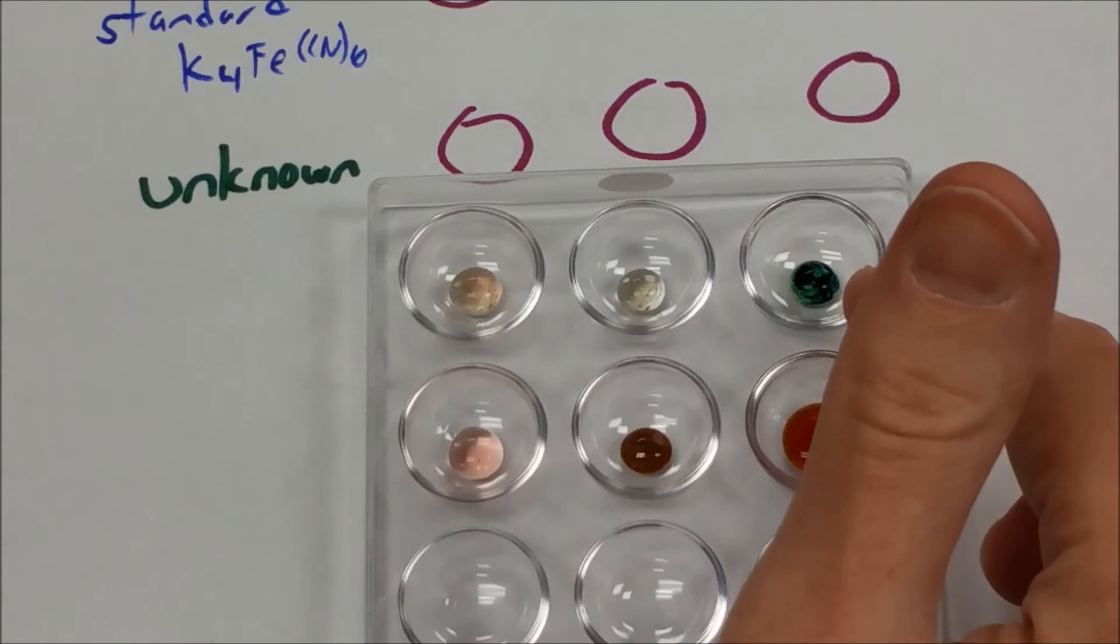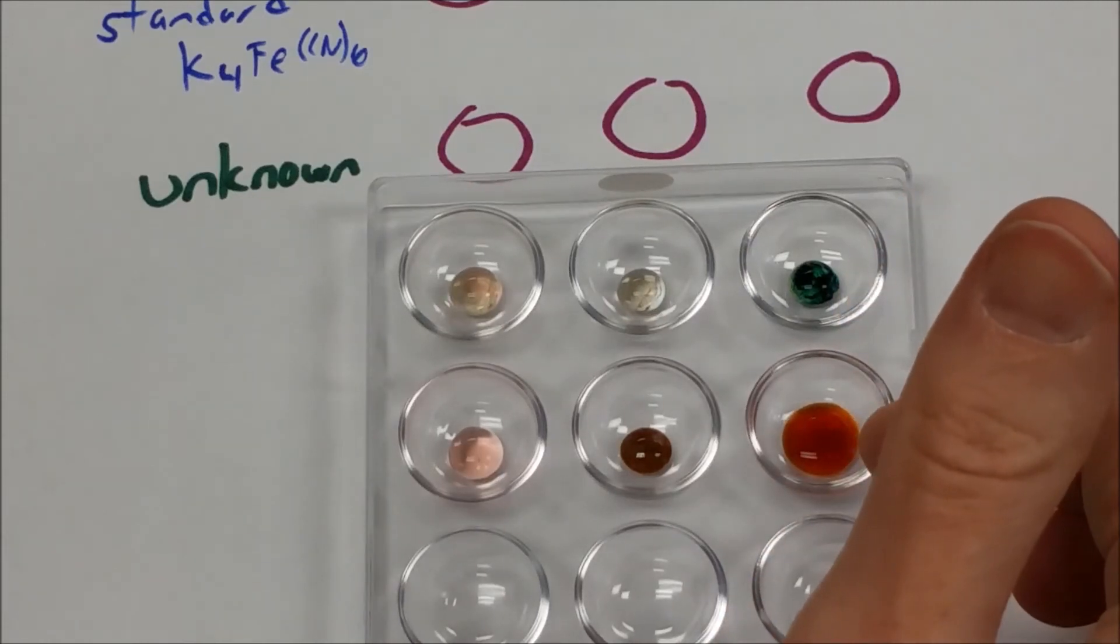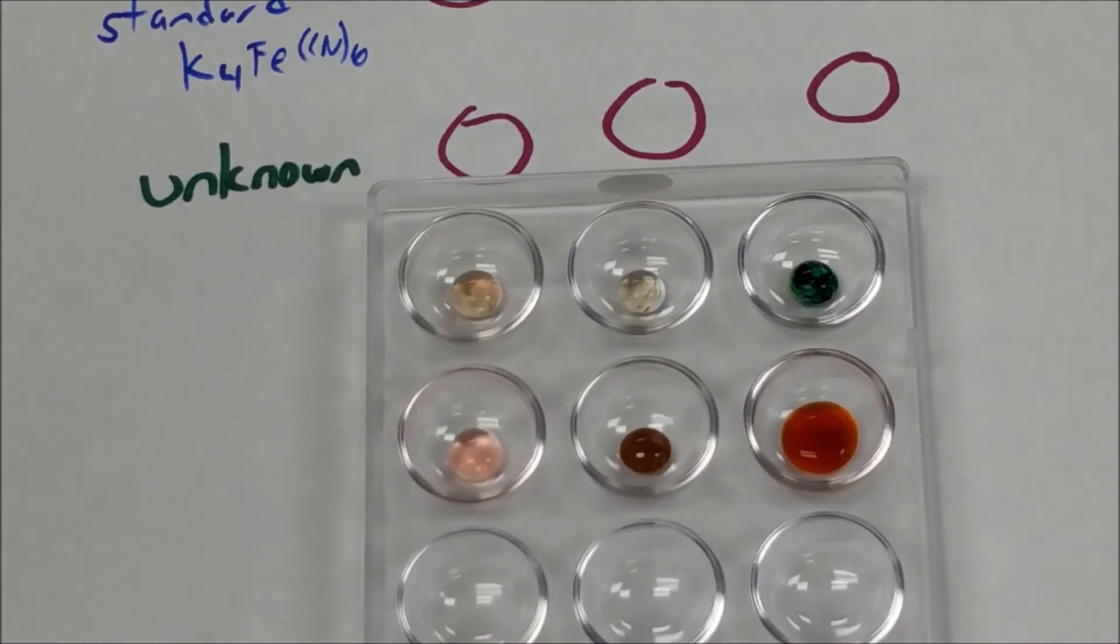And then here we're looking at the iron 3+ plus ferrocyanide, and here we're looking at our unknown. And in each case, we're seeing something happen for both.